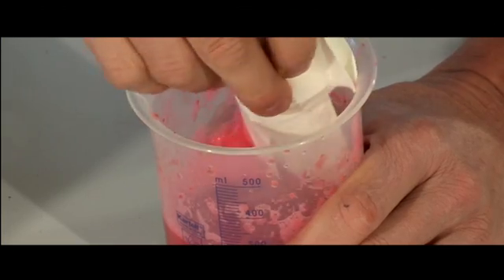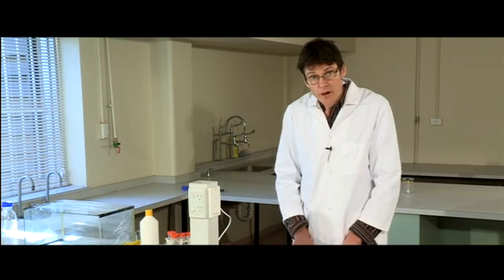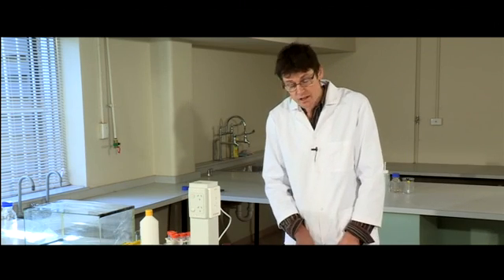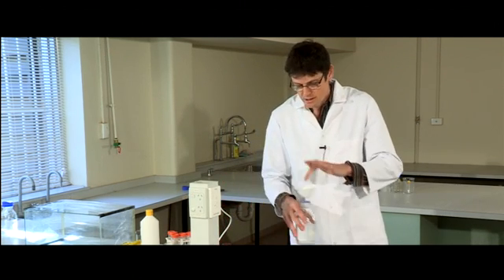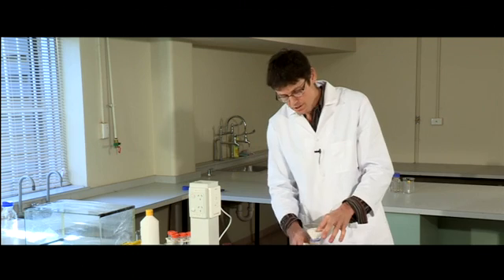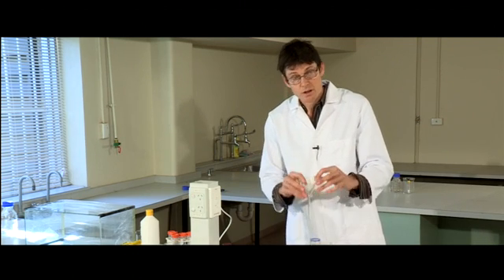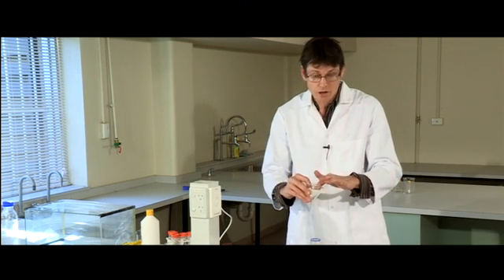Now we have to isolate the DNA. I've gently swirled it every now and then for about five minutes. To get our DNA out requires a funnel like this and a bit of filter paper. You can use coffee filter paper if you've got one of those.